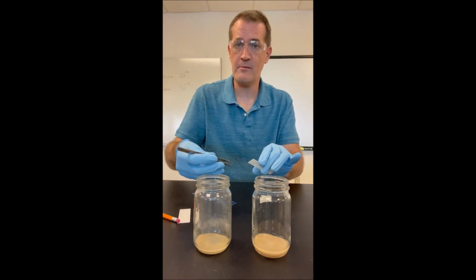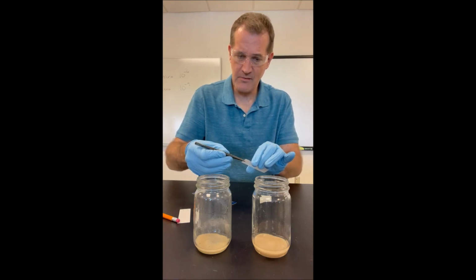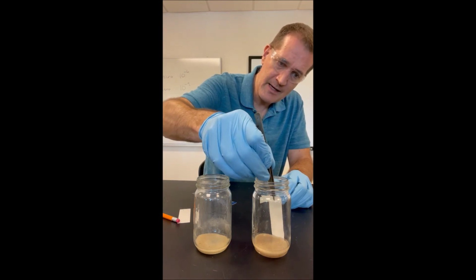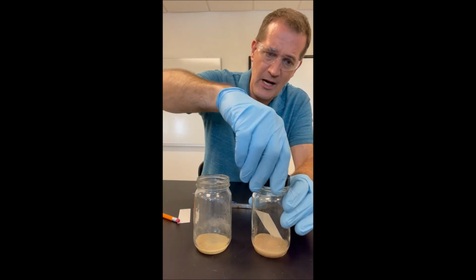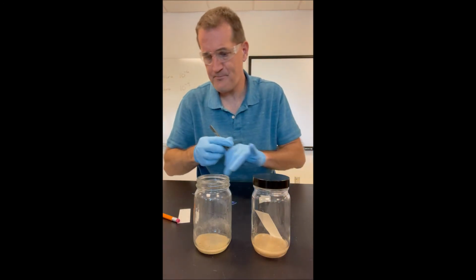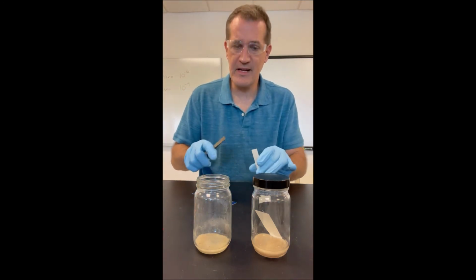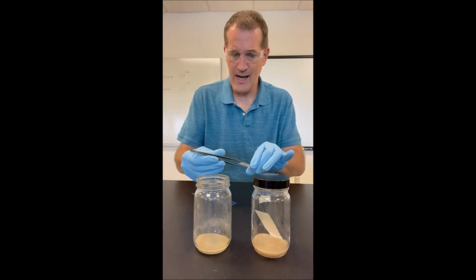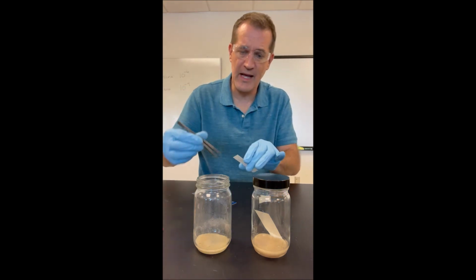Now we could put more than 1 plate into 1 jar, but it's easier just to put 1 plate in 1 jar, so I'm just putting this in and I drop it down. The solvent is slowly making its way up the top of the plate, and it's going to take the compounds with it to some degree. So the plate I just put in the TLC jar was the caffeine, Tylenol, and aspirin. And now I'm going to do the same thing with my unknowns A and B.